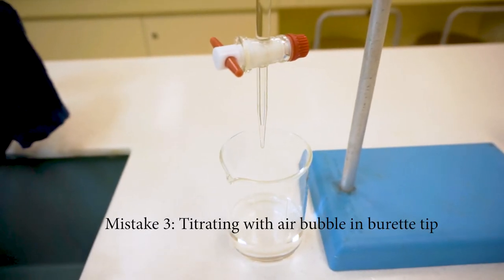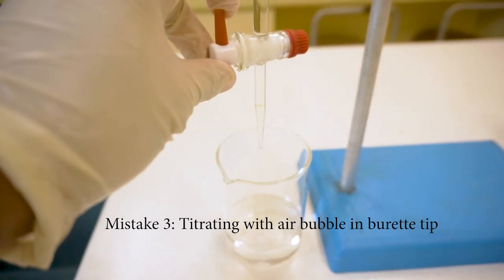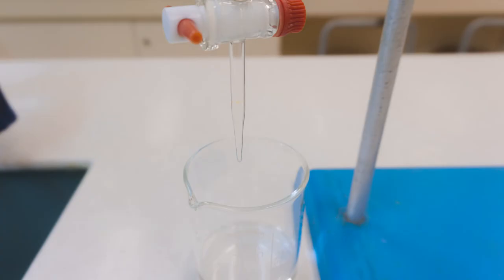Mistake number 3 is that students often titrate with an air bubble in the burette tip. This will cause inaccurate readings because the tip of the burette contains air rather than solution.